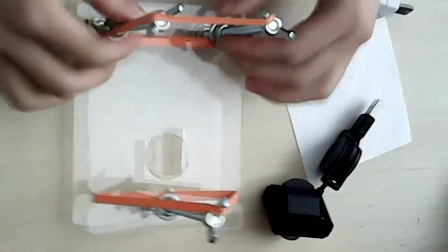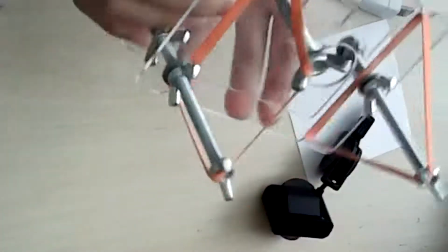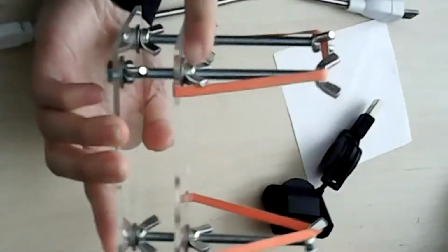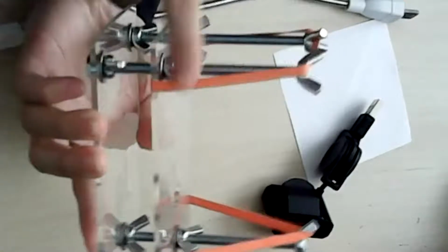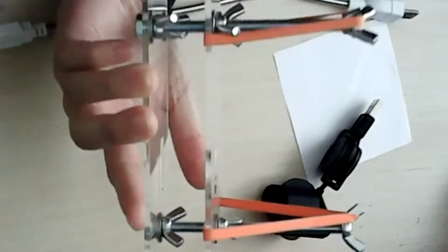So yeah, now it's pretty sturdy. It stays, and it will drag the top stage up to where the wing nut is. And then if you want to adjust, you will have to adjust all three and make them somewhat parallel to make it go up and down. But right now, we'll keep it here for now.